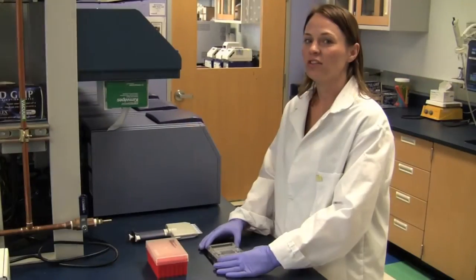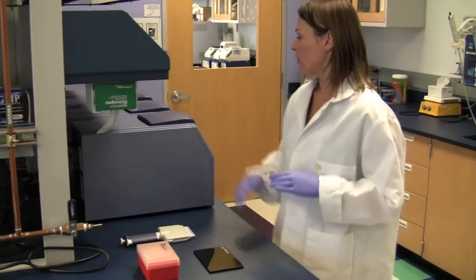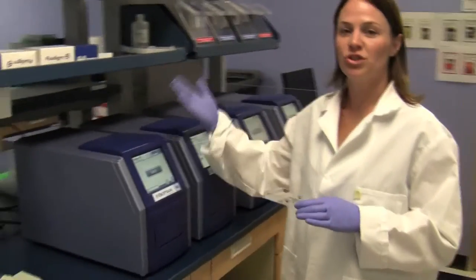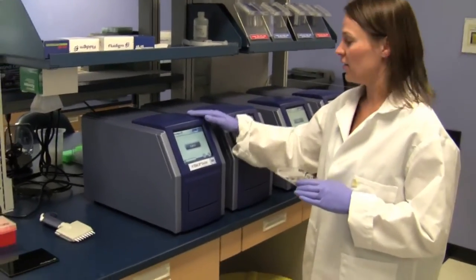So once I've finished loading the samples and assays into the chip, I'm going to place it on the IFC controller, which is the instrument that actually pushes all of the materials inside the nanofluidic chip.